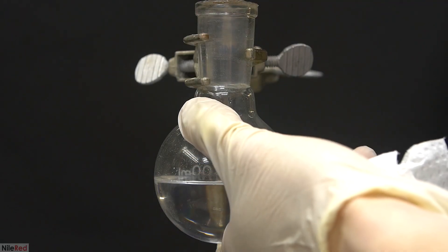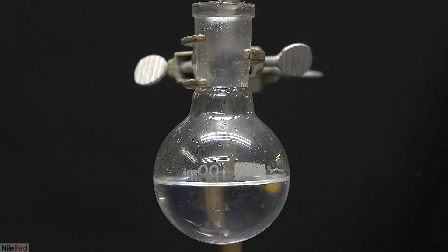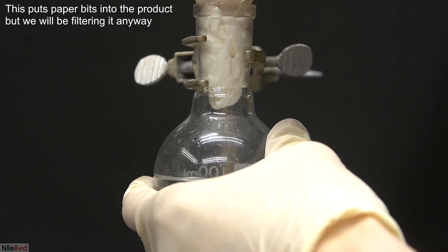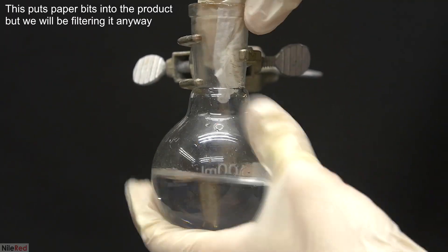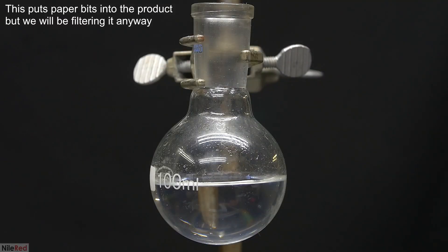When I'm ready to process the benzaldehyde, I remove the stopper, and I clean the ground glass joint with a little bit of paper towel. The joint is still covered with vacuum grease, and while it's probably okay to pour the benzaldehyde out over it, I like to clean it first.